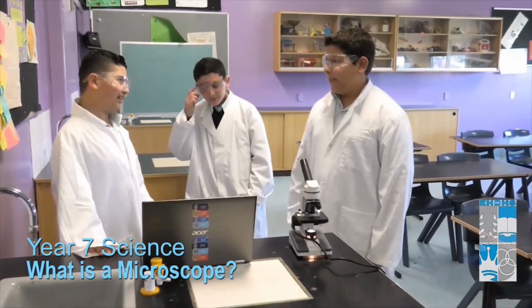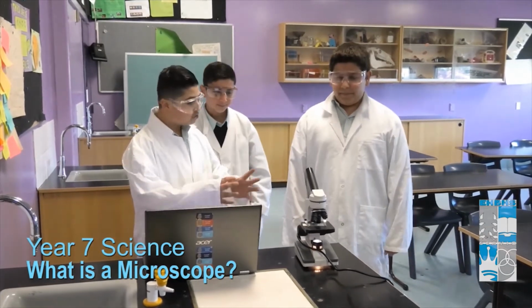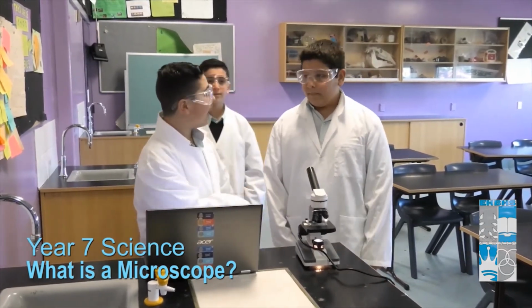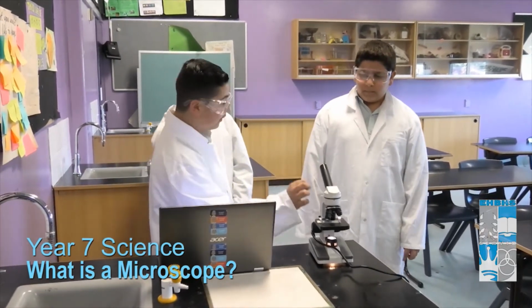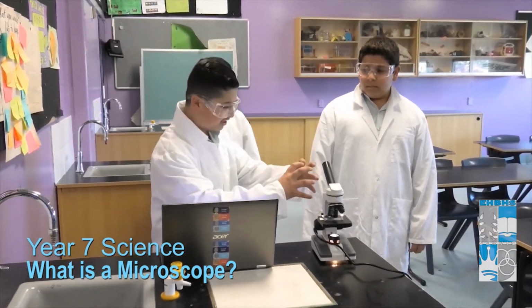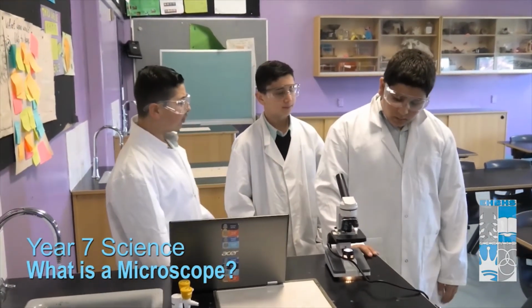Well, let's get back to the microscope. The microscope did not look like this. I researched it yesterday, and it was actually very, very old. It looked very smudgy. It didn't even have these parts. Did you know that? I didn't know.